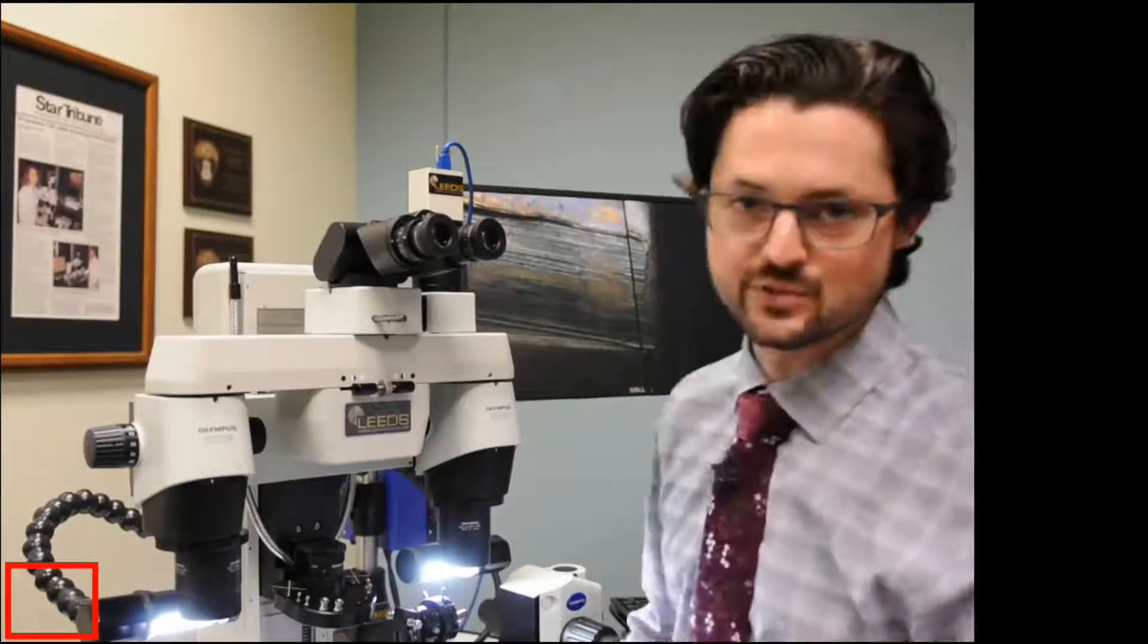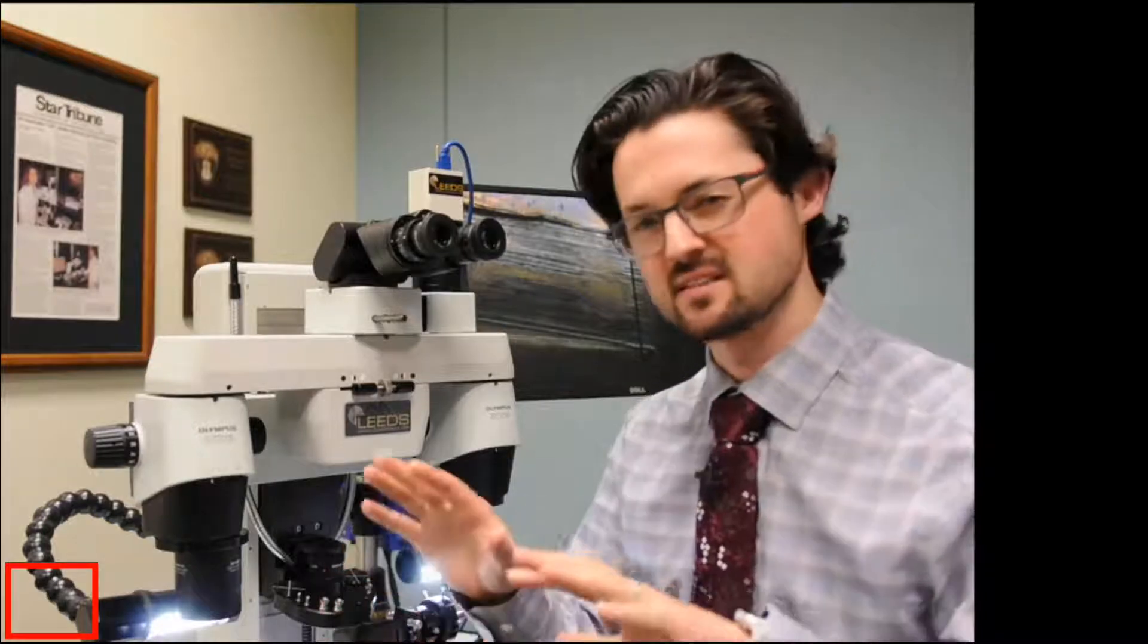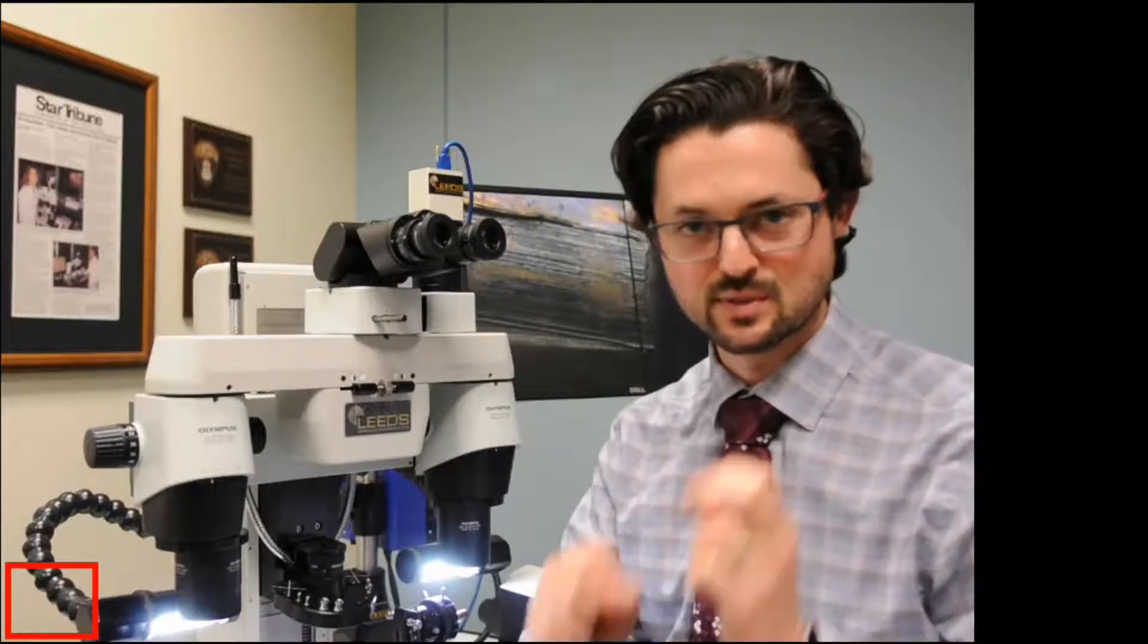But then also the dividing line will stay in focus too, which is a really nice thing. And instead of having, like, is it in focus, is it out of focus, it can be really helpful just to have a sharp, crisp, good-looking image.